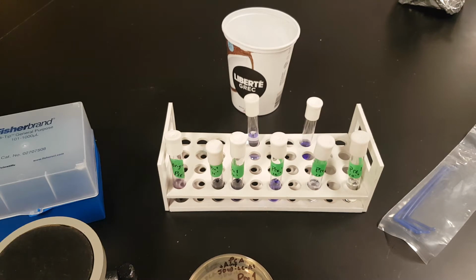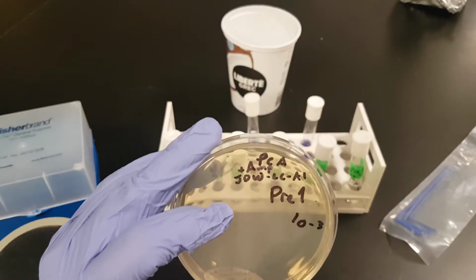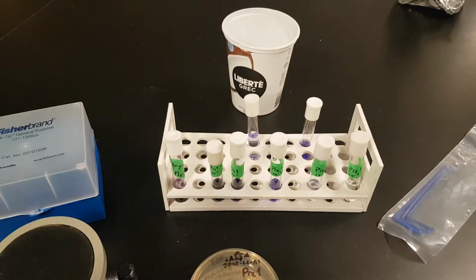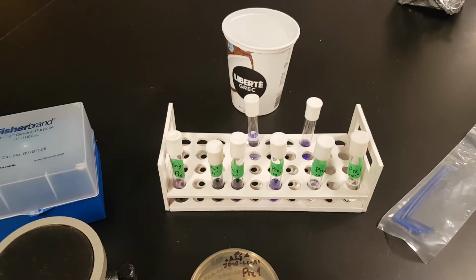Not important. What we're doing is we are looking at antibiotic resistance and selective media, and that's why we're combining these two things. Okay, so the point of all of this is that you are dealing with bacteria that you suspect might be resistant to ampicillin. Antibiotic resistance is a major problem. It's like an arms race. We come up with new antibiotics, put them out there. Bacteria are subjected to them. Some of them evolve and survive and go on and become resistant to those antibiotics, and so we have to come up with new ones over and over again. Okay, so this is sort of demonstrating how that works.